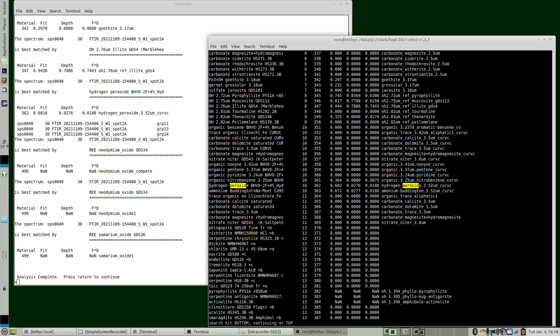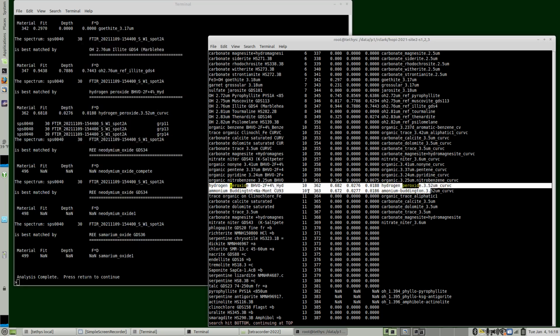Now let's look for, so here's our hydrogen peroxide. So the fit was 0.68 versus 0.67. So the hydrogen peroxide still had a slightly better fit. What this is telling us is that these two are very close and very hard to tell apart, and maybe a different ammonium compound would do better. It's interesting that they both have such similar bands. So the question is, what other examples of ammonium compounds do we need, or do we need yet another ammonium compound, not a mineral, which is the only thing we have in the library?